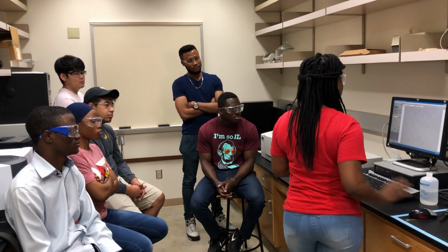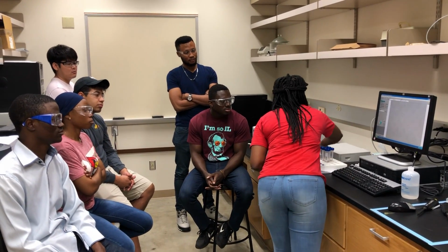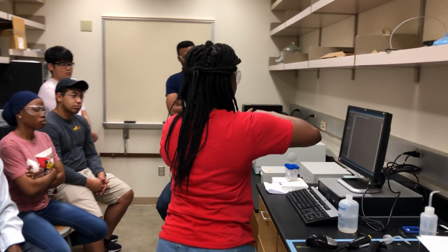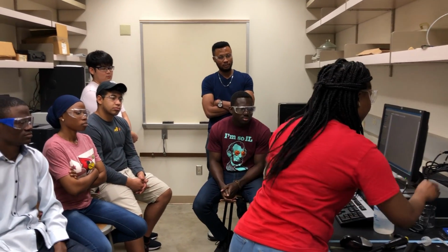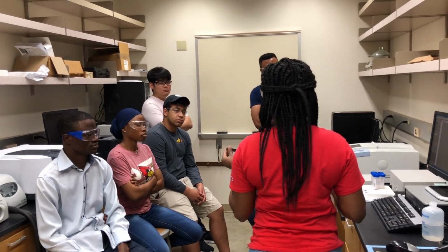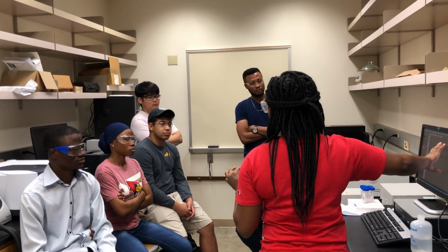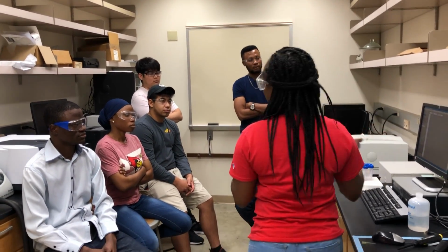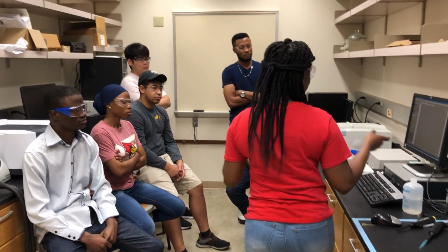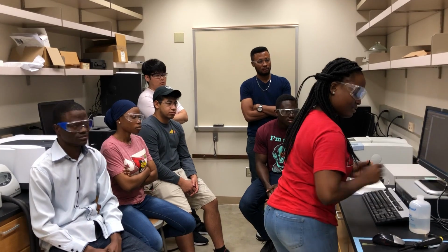So now let's move on to analyzing our samples. You know that we took 3 different concentrations of our nanoparticles, and those contribute to their sizes. So with the UV patterns, you are going to know that this is a bigger particle, this is a smaller particle, or this is a medium-sized particle. So let's take a look at this.